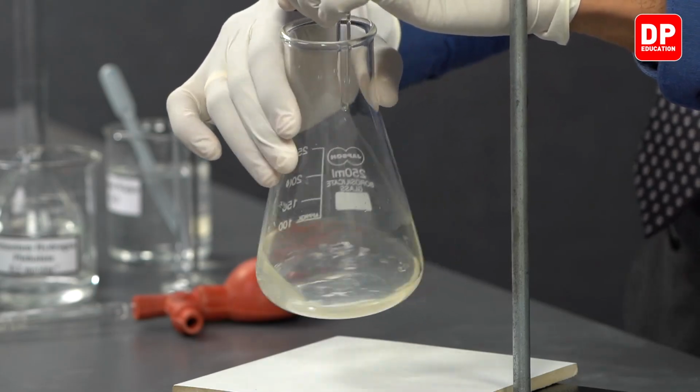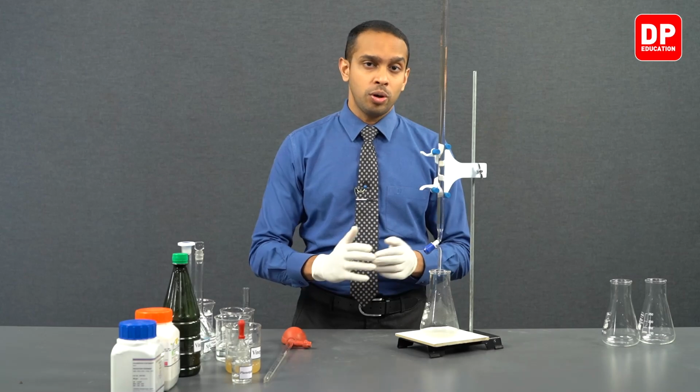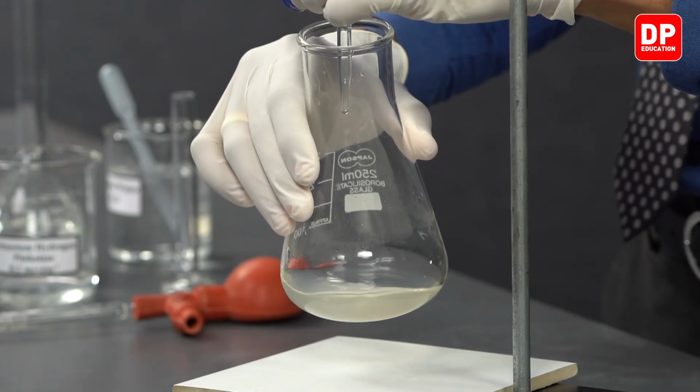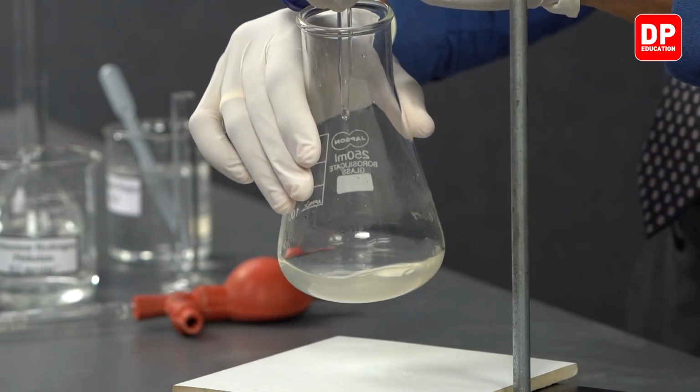As we add more and more sodium hydroxide, there will come a time when the pink coloration will persist for a little while longer before disappearing. If the pink coloration is not going to disappear immediately, this indicates that the acid concentration of the solution at that point is very low. And after all of the acid is reacted, you will observe a persistent pink color. Right now, the pink color disappears as soon as I mix the solution, indicating we still have enough acid.